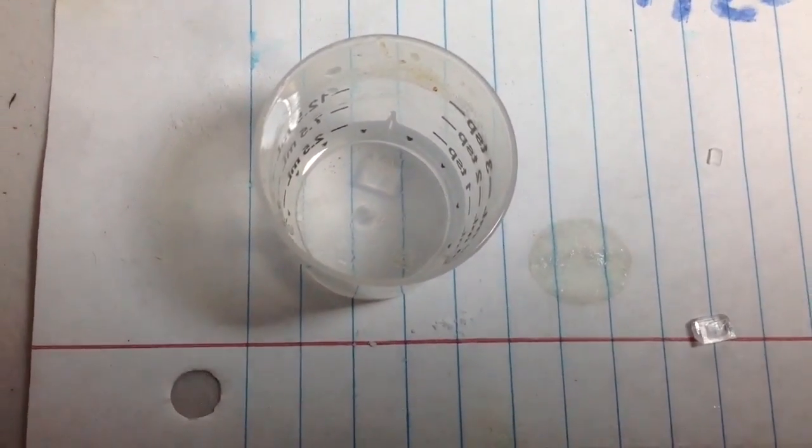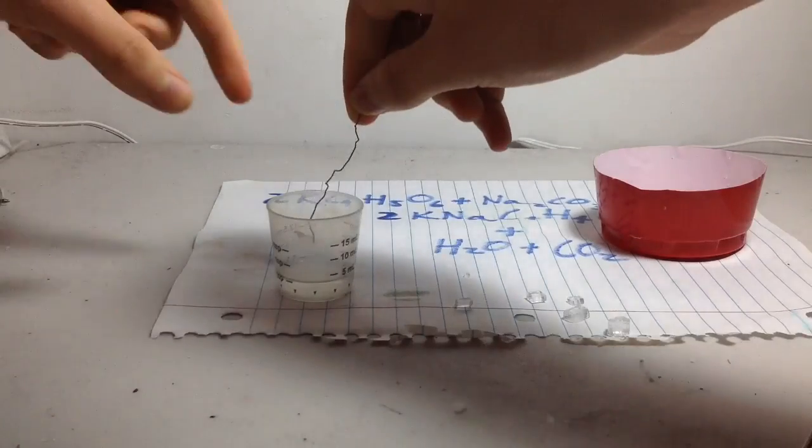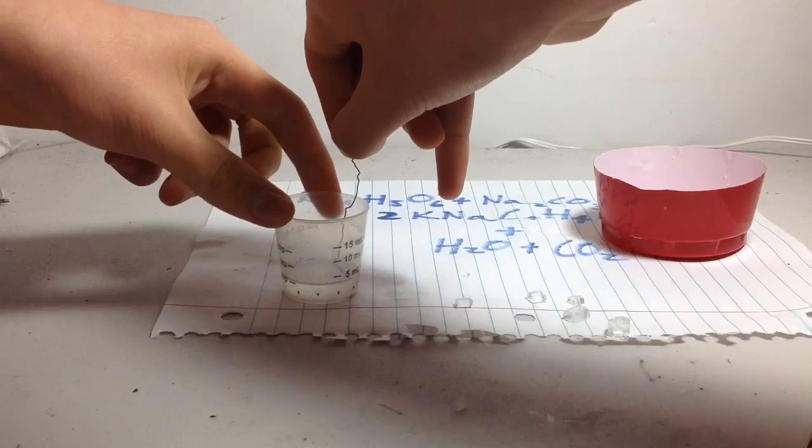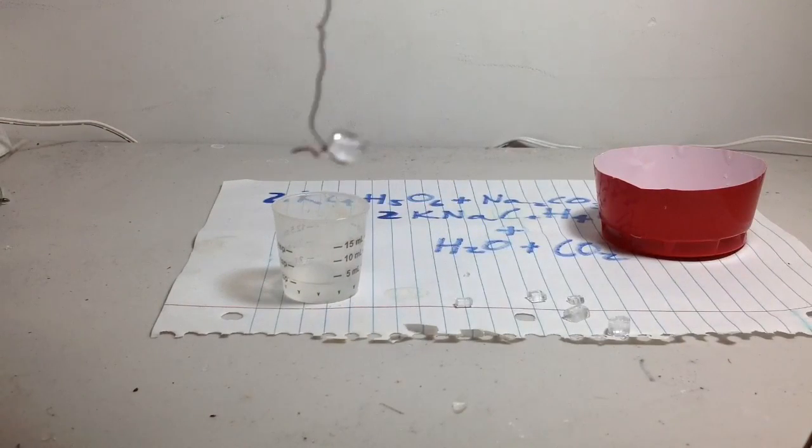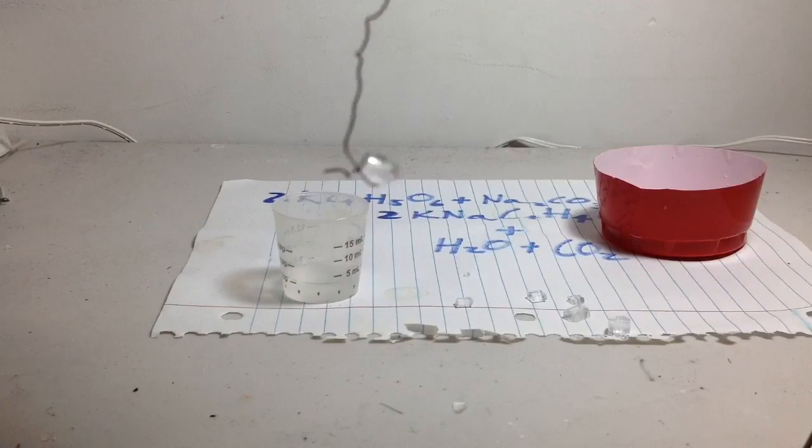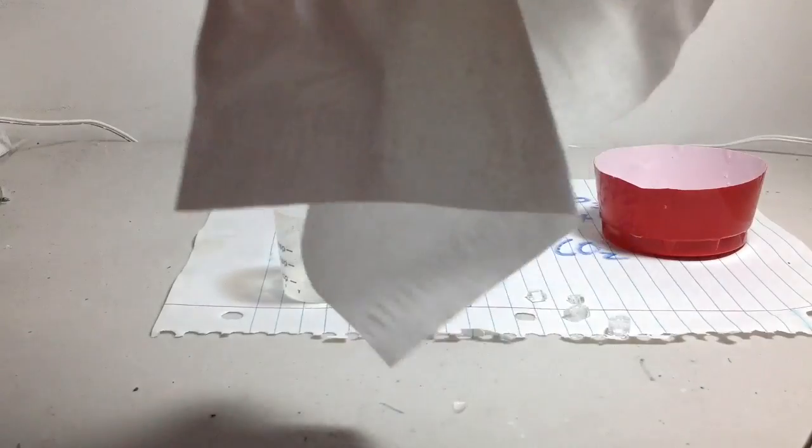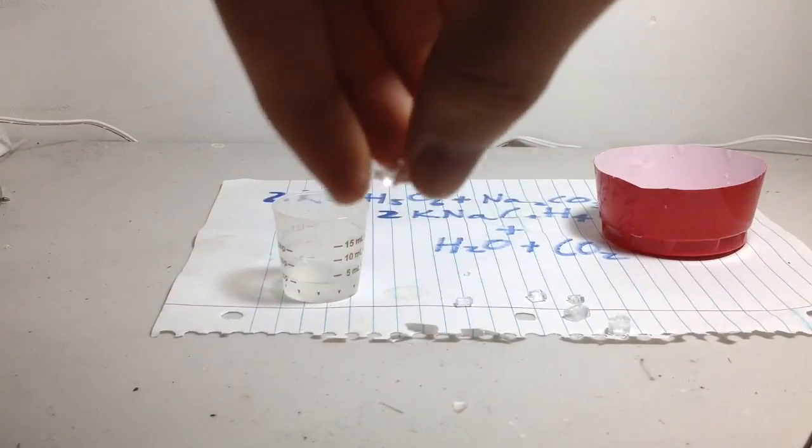Here I am in the evening, and I think the crystal is ready to be harvested. I'm just going to take this wire loop and try to scoop it out of there. Here we go. That's another crystal to add to our collection. First, I'm going to dry it off with a tissue, make sure no crystal residues form at the surface. There we go, it's another beautiful crystal to add to our collection.